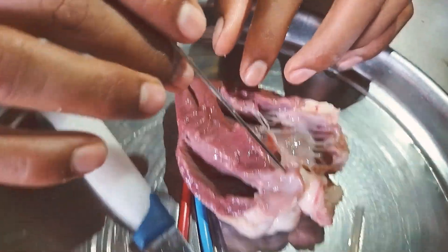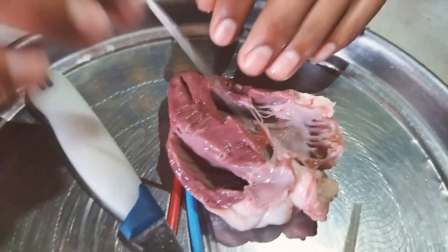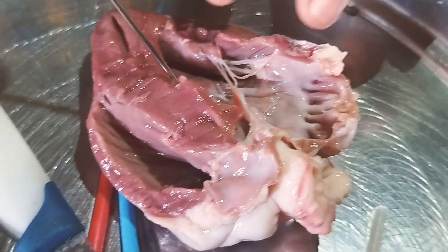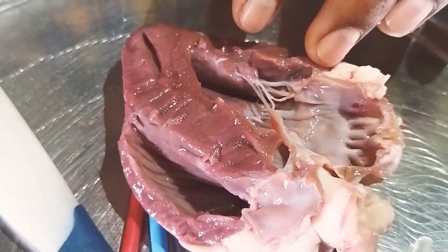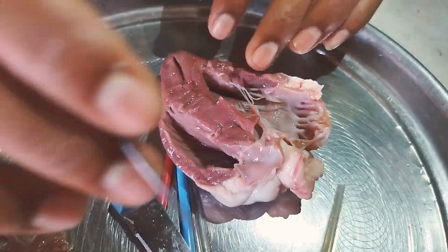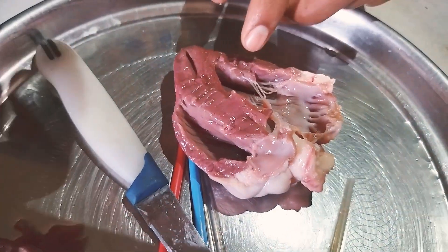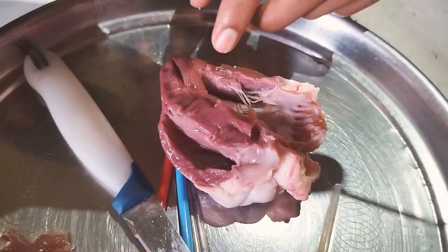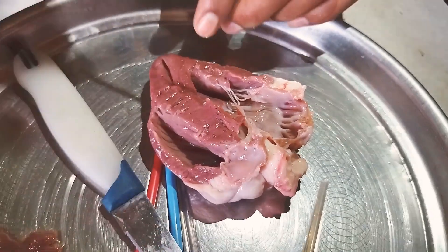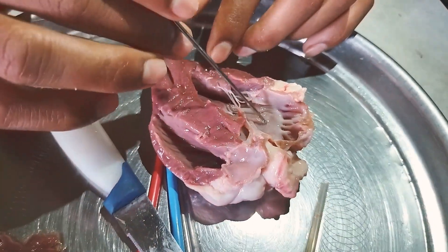We can observe that there are two circulations — a double circulation of our heart. One is where the blood goes to the lungs and brings back oxygenated blood. The other is where the blood goes to all our body parts and is brought back to the heart. So our human body has a double circulatory system.